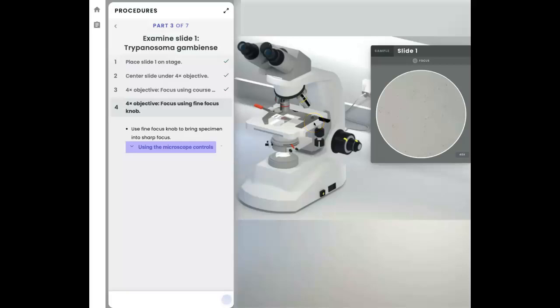Okay, so this is now part 3 of the microscope exercise from within Pearson. And I understand by some of your comments that some of the controls are a little tricky to use. At this point, just a few minutes ago, I actually used the coarse focusing knob to bring this image into focus. And I noticed that what happens, and I think many of you have already pointed that out, is that you get a check mark once you get it focused. I cannot get back because I get a warning that I have already completed that step.